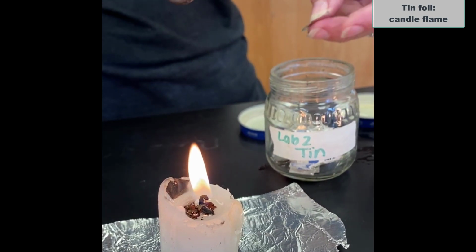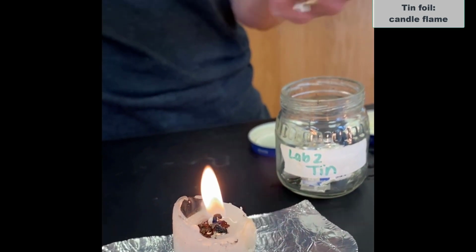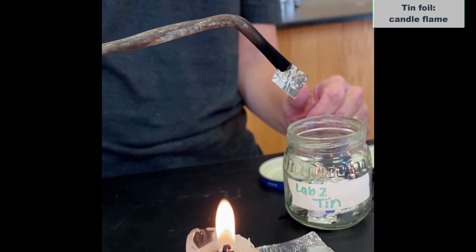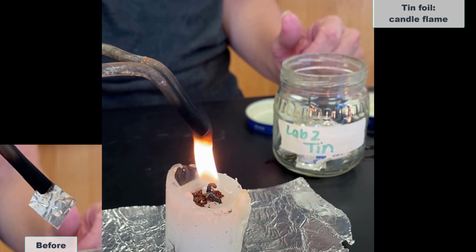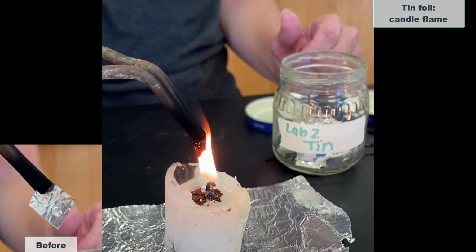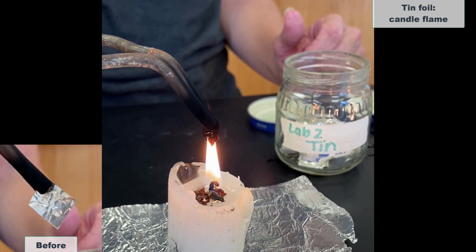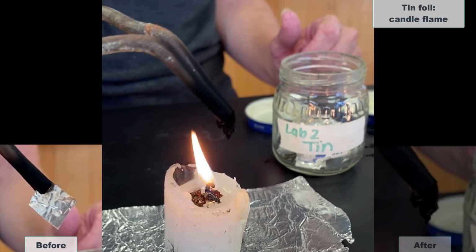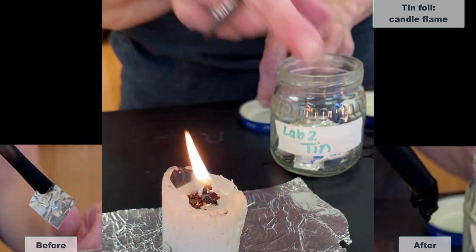And this looks like tin foil, but tin foil is actually made of aluminum. This is actual tin foil. So there's what it looks like beforehand. And if I put it into the flame, I got a change pretty quickly there. And there's what it looks like afterwards. It's still solid.